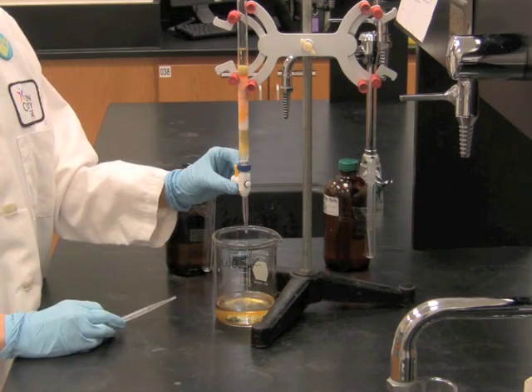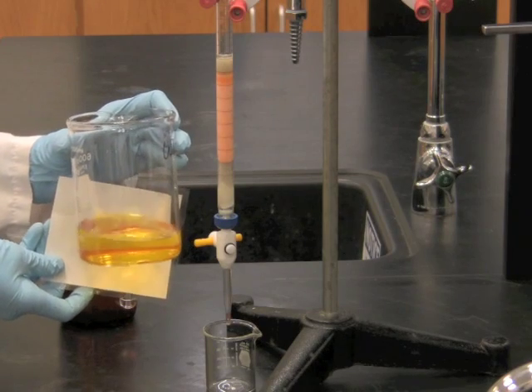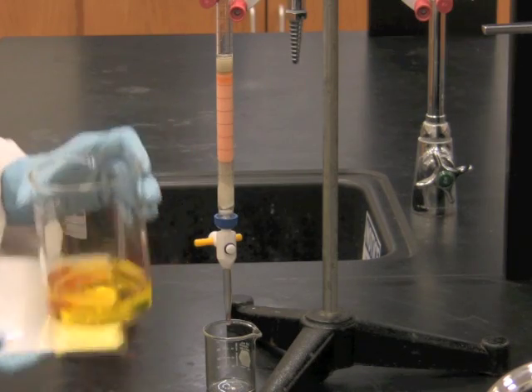Keep adding solvent, draining it to the top of the sand. All of the beta carotene that was in the sample has been eluted off the column with petroleum ether.